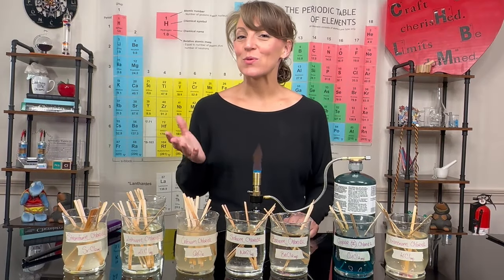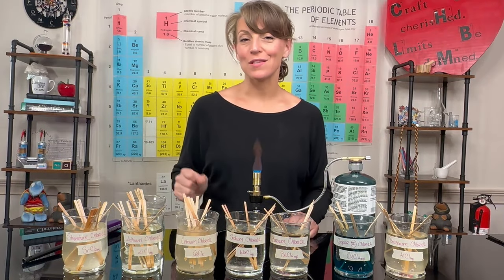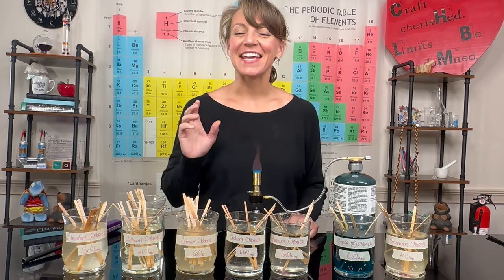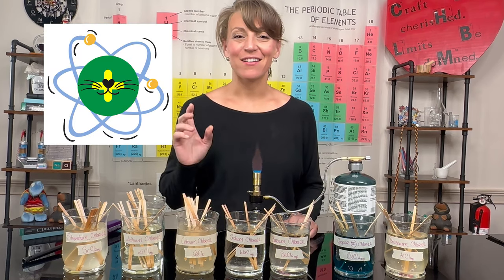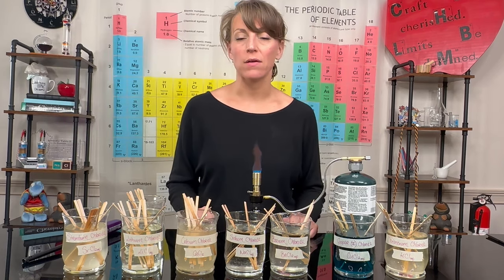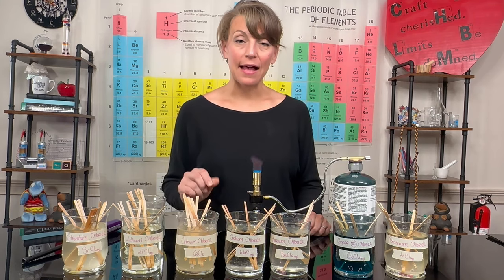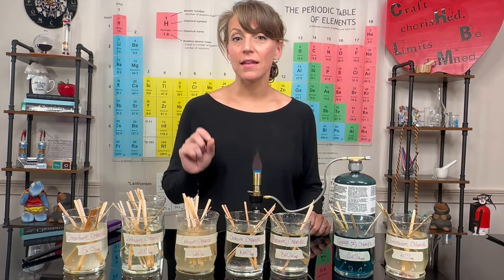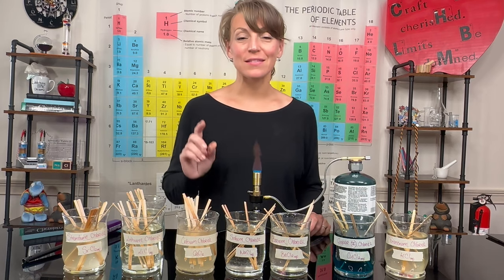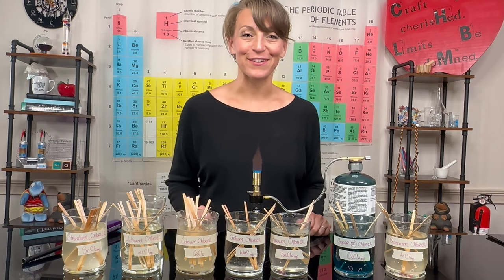Did you happen to notice what was different between each one of these solutions? That's right — it's the cation, or the metal, in each one of these ionic compounds that's different. And that cation in each solution is what is causing the flame to be a different color.